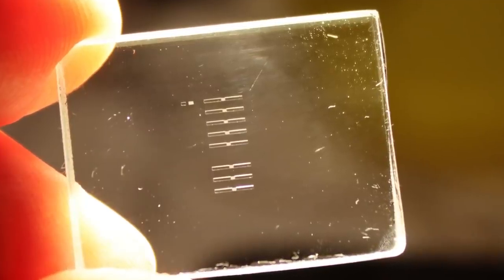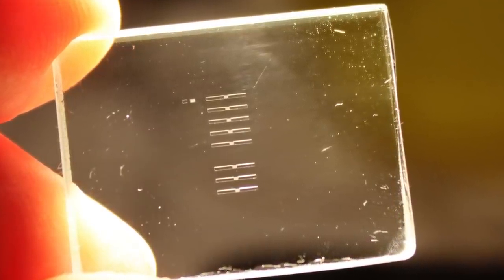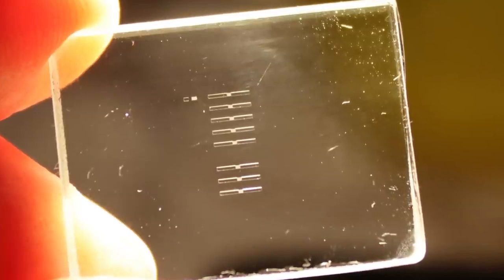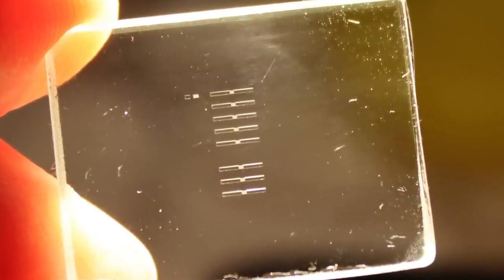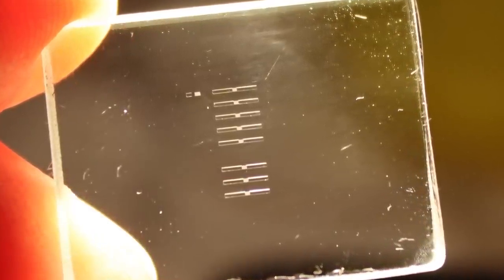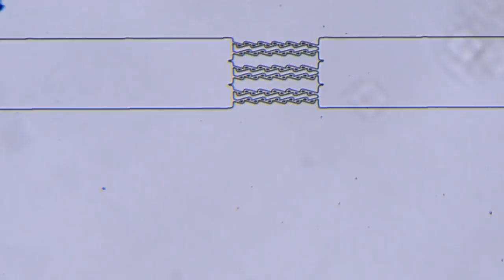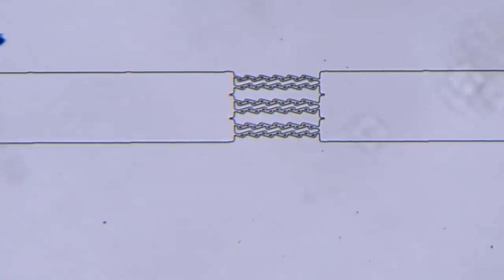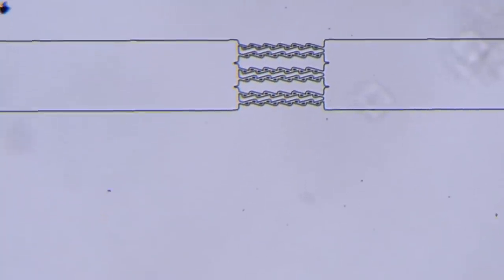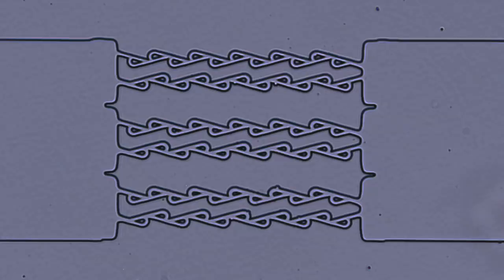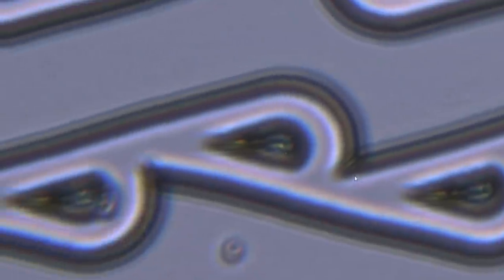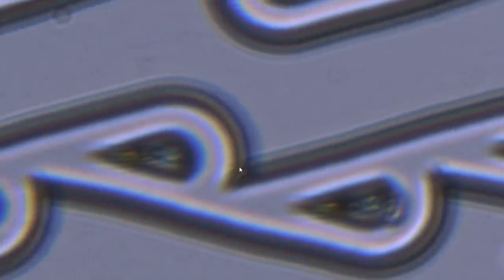And as others have said before me, because at this level of magnification, they are actually too small to see. The things that you can make out are the much larger connection pipes to the valves. So again, we have to look at them under a microscope. And here they are. There are 6 of them between each set of connection pipes. They are about 300 microns long and have a channel width of 4 microns. Actually these are way narrower than the smallest blood vessel in your body.